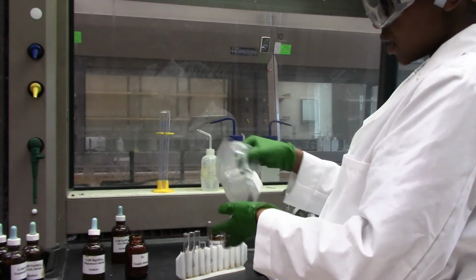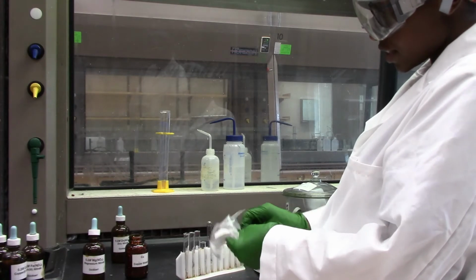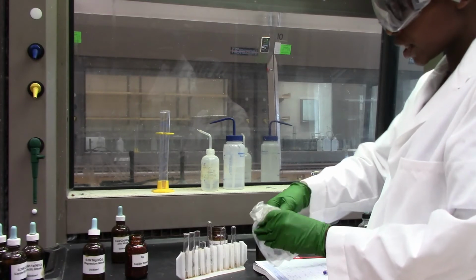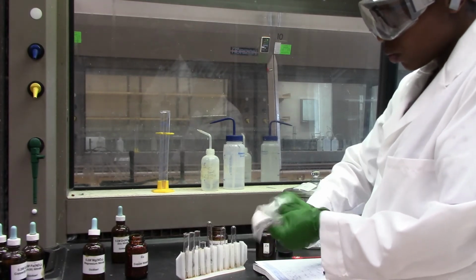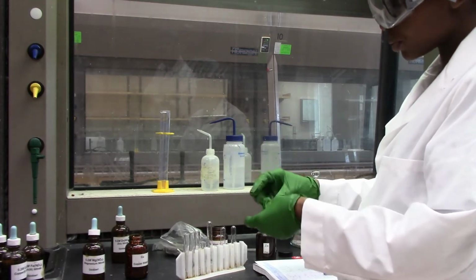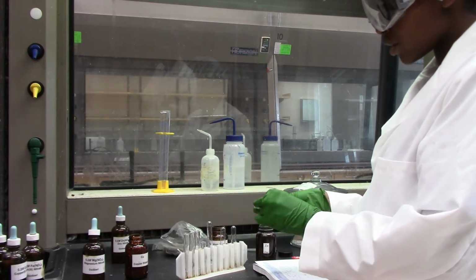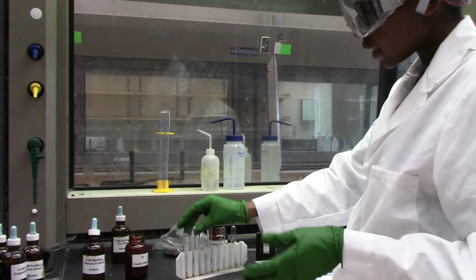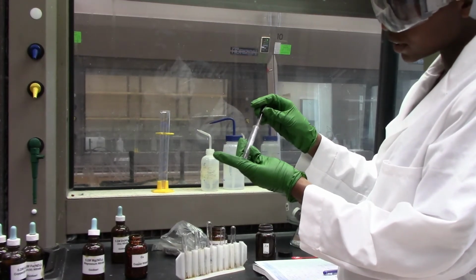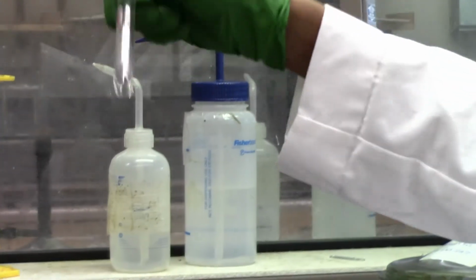And how about iron? This is now comparing iron versus magnesium. And if you were here in person, I would ask you to predict what would be more reactive based on what we've done before. We were able to put magnesium inside of an iron solution and we saw some reaction. And so if it was reactive, then we might expect that iron is not going to be as reactive with magnesium, but let's see. Will iron displace magnesium in solution?